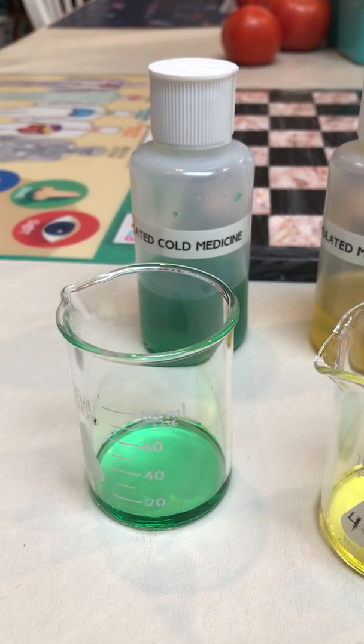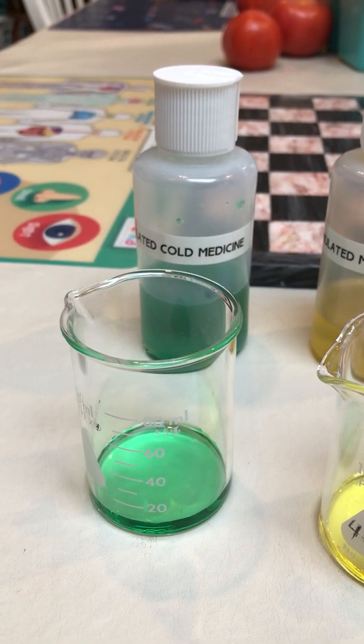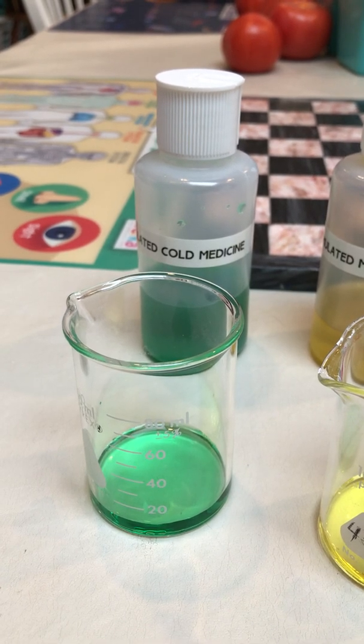Ladies and gentlemen, we're about to test our over-the-counter medications for cyanide contamination using the cyanide test.